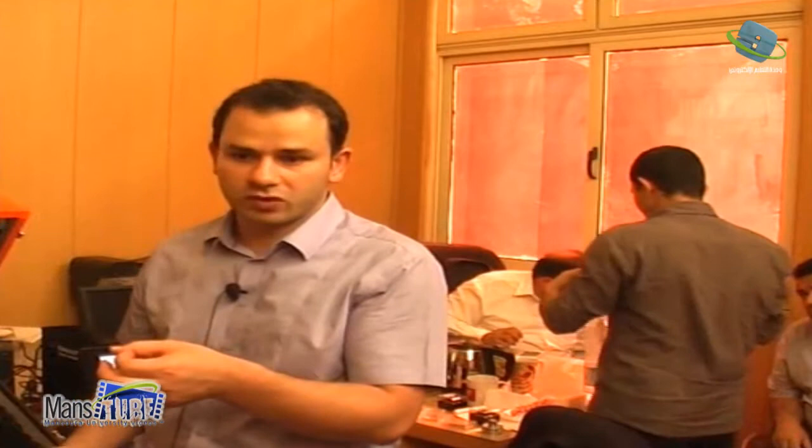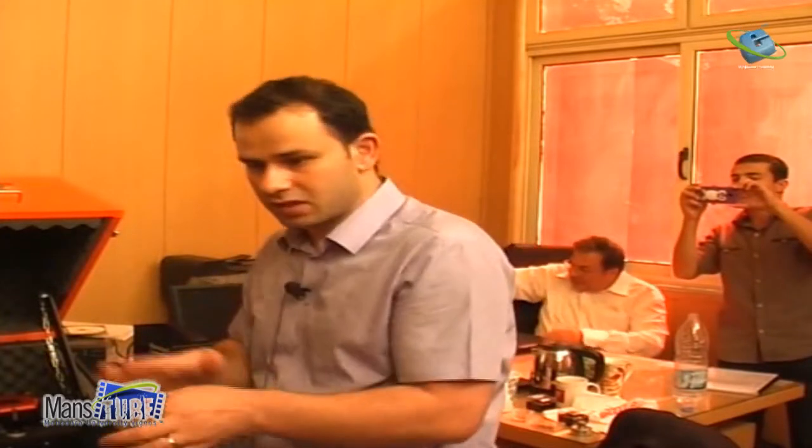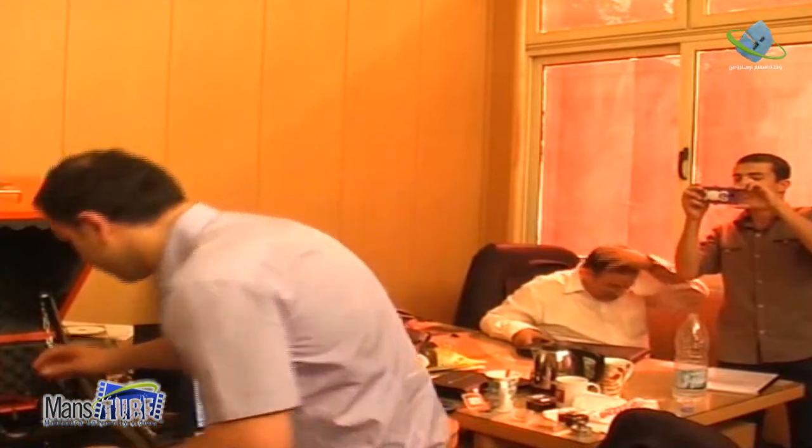I can explain later what this is. Let's say it contains salt or magnesium to make the surface neutral, and then the particles will stick to the surface, if you don't want your particles dry in air. Once they stick to the surface, you can add liquid and rinse. You put some water, remove it, add new water, and remove all the particles, and just some particles stick on the surface. This is something we can explain later, how to prepare. This is sample preparation.